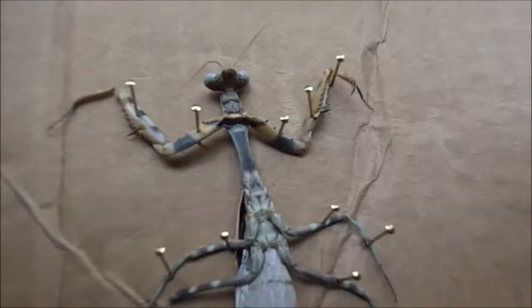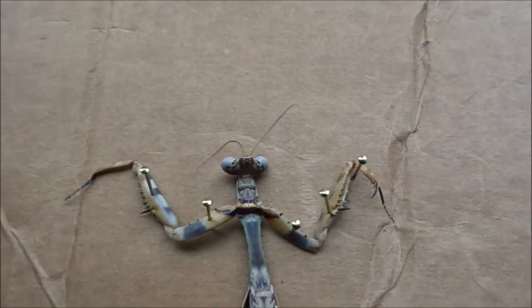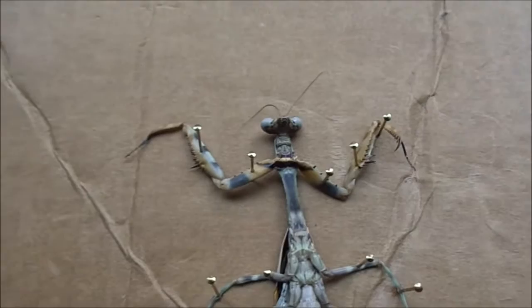It's all pinned out now. Here you can see much better the structure of six legs. There's the head up here, so you can see two eyes, antennae, and the mandible just there. You can see it's dark with a banded orange colour on the inside of the forelimbs. Mantises will naturally adopt this pose of arms splayed out, looking as big as possible — this is called a threat display. They'll do this when they feel they're in danger, want to compete with another mantis, or basically say: okay, I won't eat you, you don't eat me.